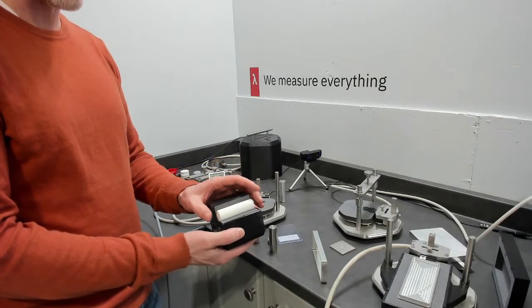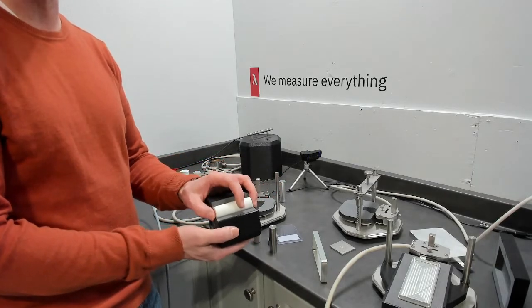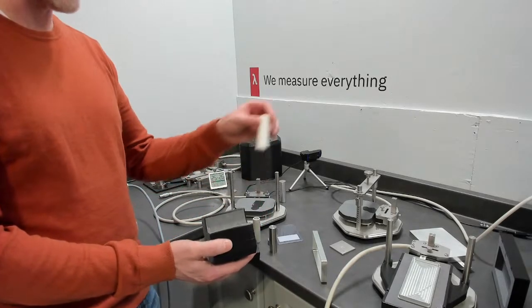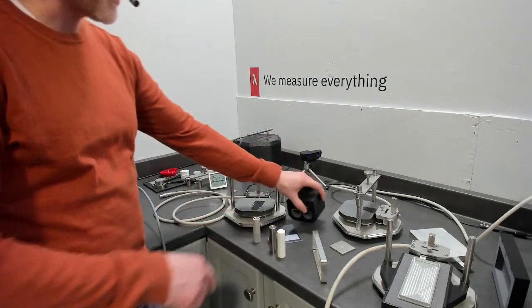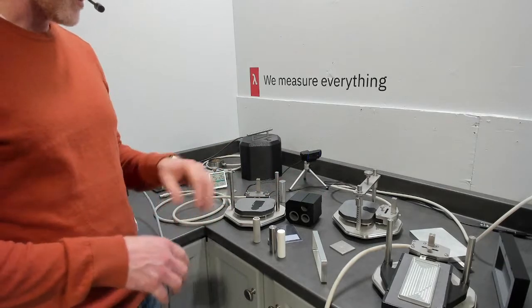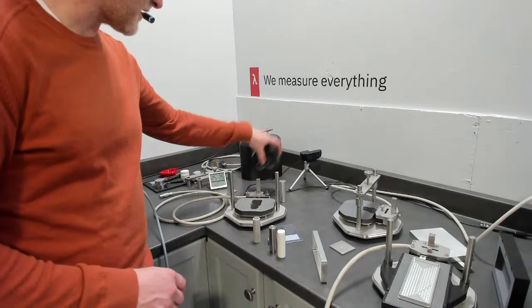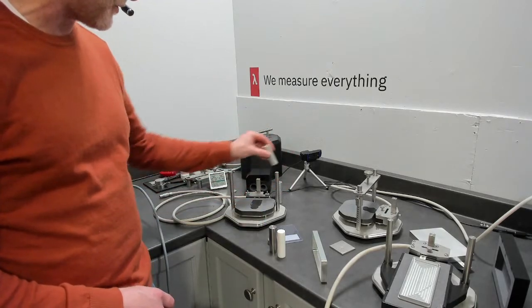And when we use our curvature correction on these measurements of these homogeneous materials, we get very good results. Without the curvature correction, you do get some effect of that curvature. So the correction is quite helpful in that measurement. And then we have two materials with very different thermal conductivity, and that gives you some degree of confidence in the anisotropy you're measuring. So that's our setup for our specific heat on cylinders and our one-dimensional setup for cylinders.